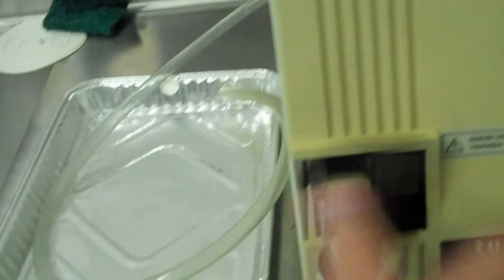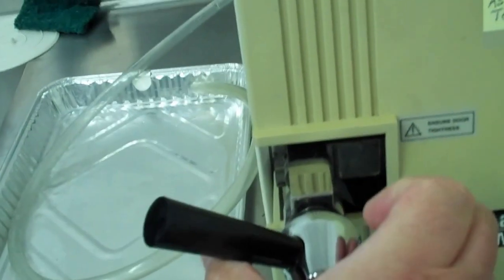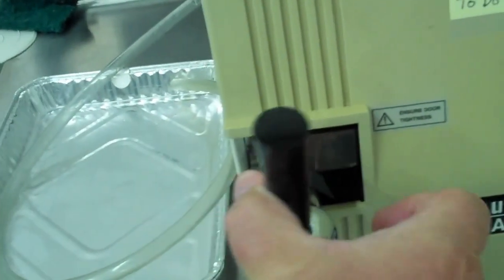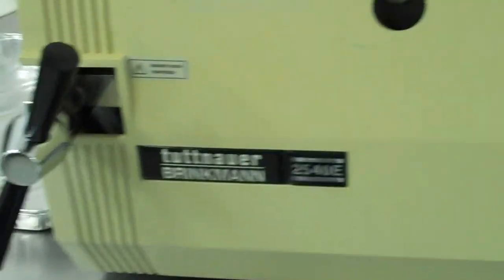But the door is not perfectly closed. The seal could still be leaking. You want to tighten the screw down to the point where it's tight enough that the gasket is making good contact and that the chamber can maintain pressure, because it's got to come up to 15 pounds pressure.